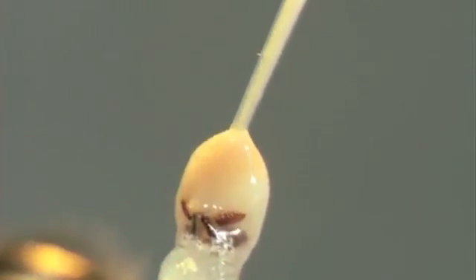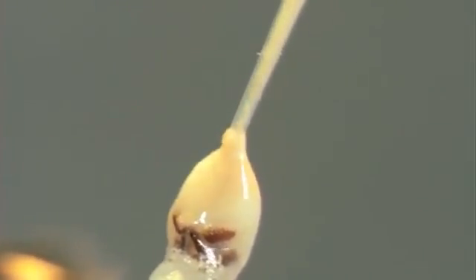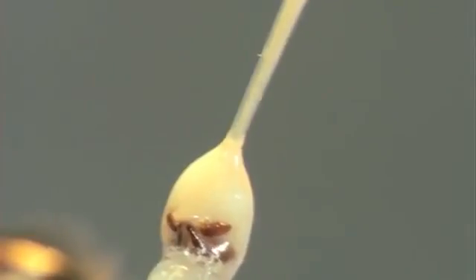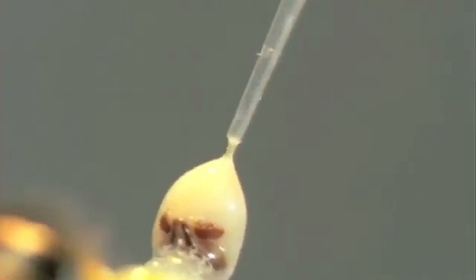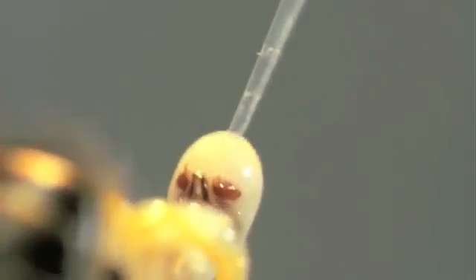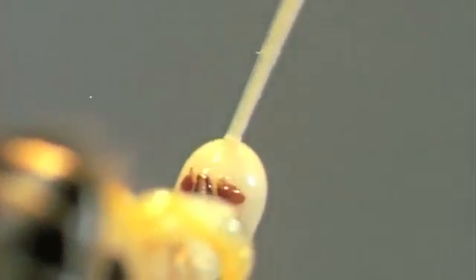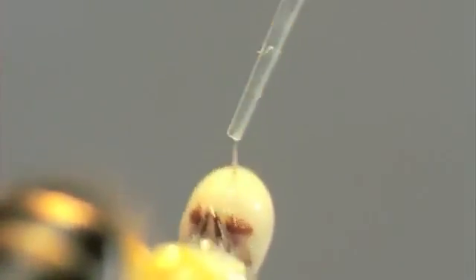Using the glass tip of the insemination syringe, merely touch the surface of the semen covering. In aspirating the sperm, none of the mucus should be allowed to penetrate into the syringe, thus preventing the cannula from becoming obstructed by a mucus plug.